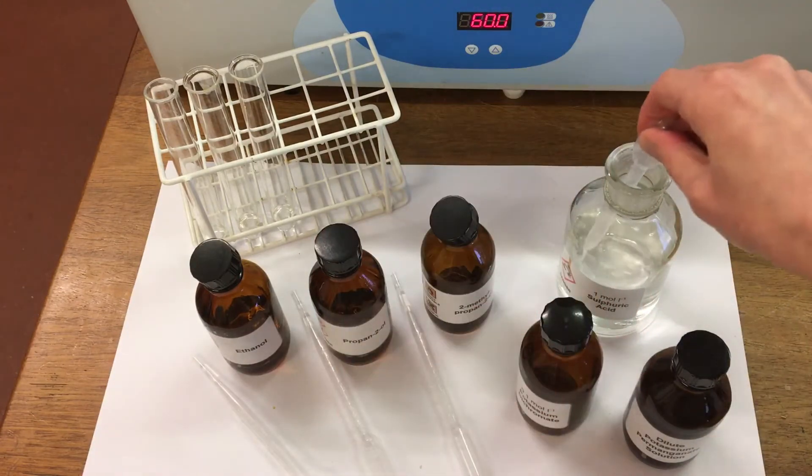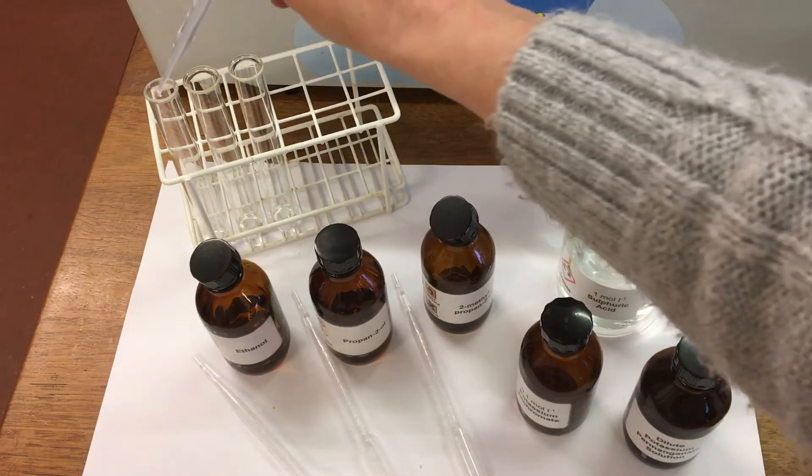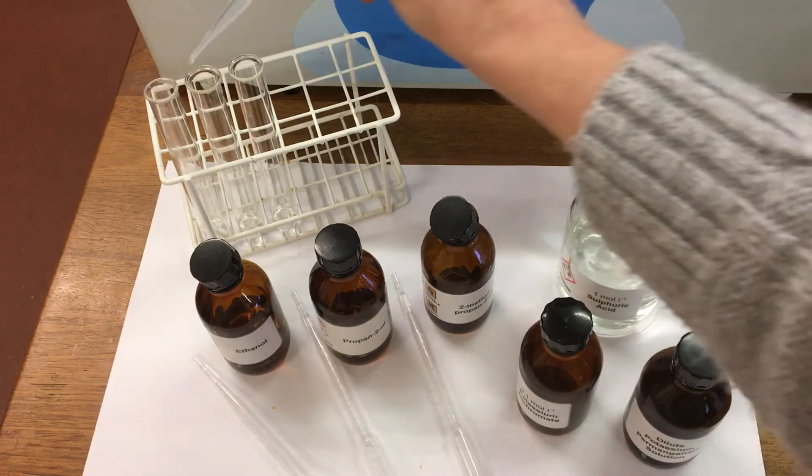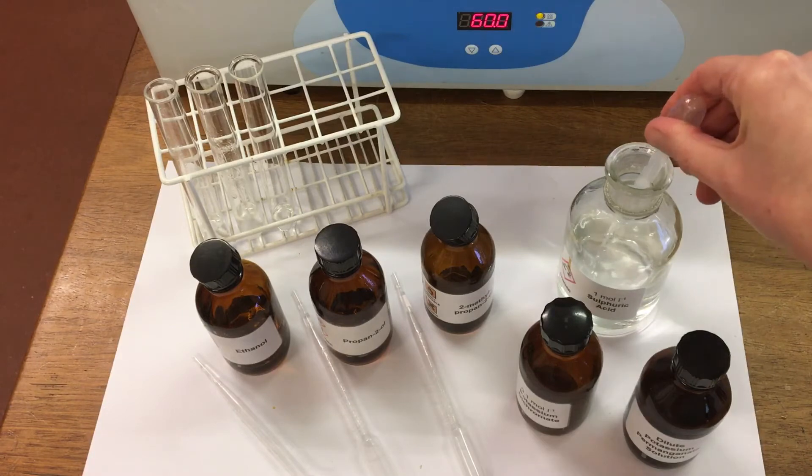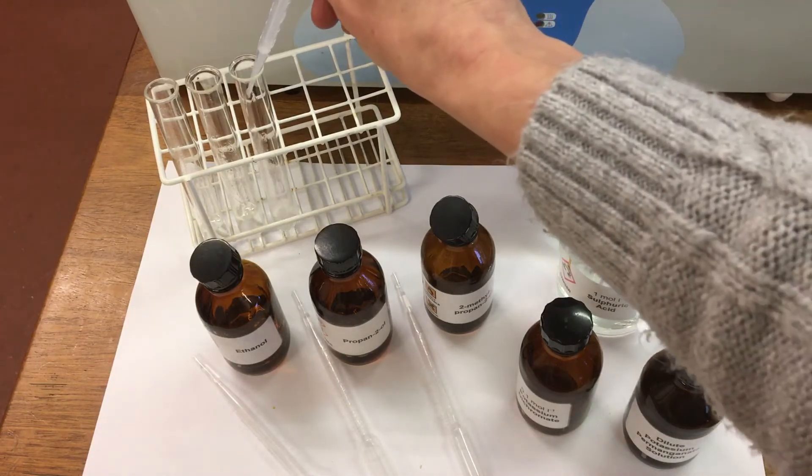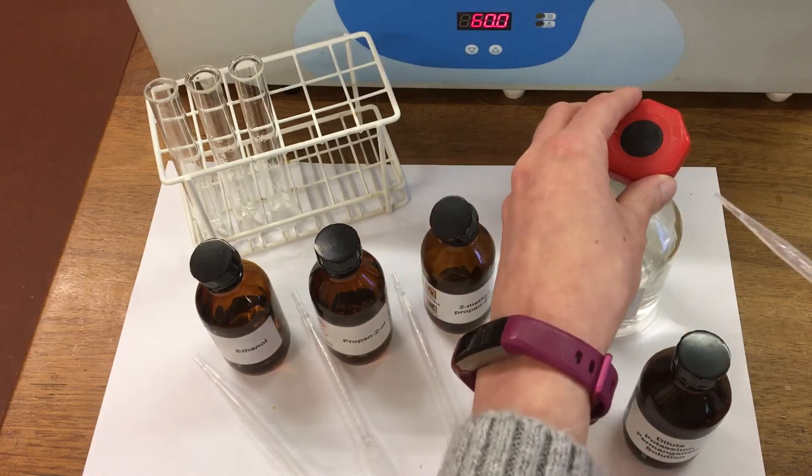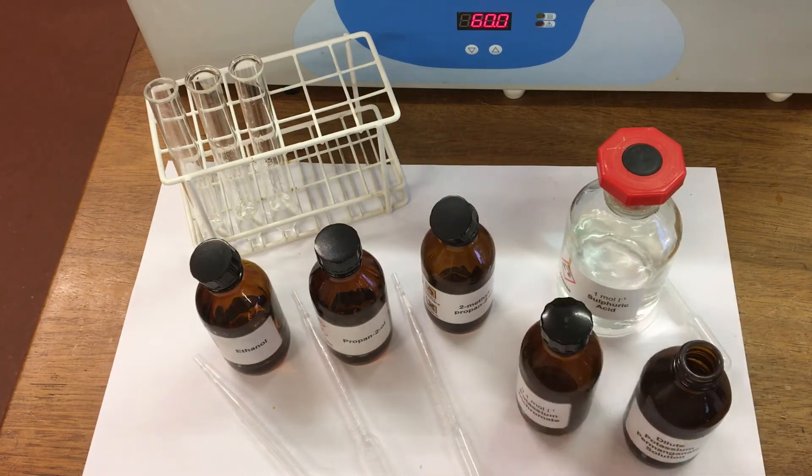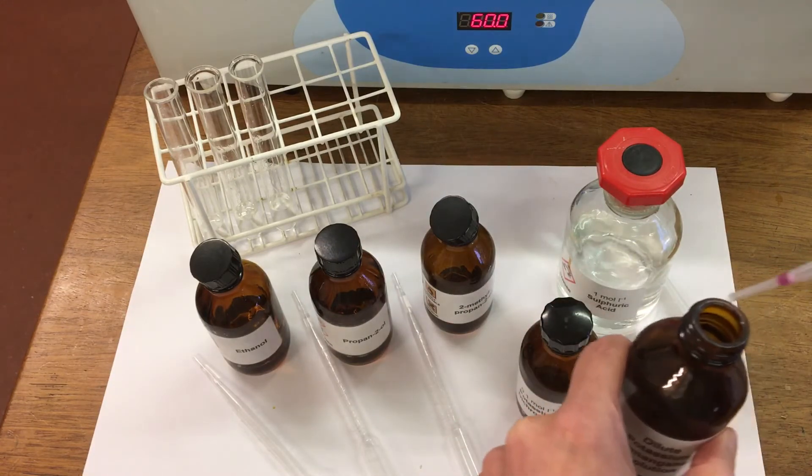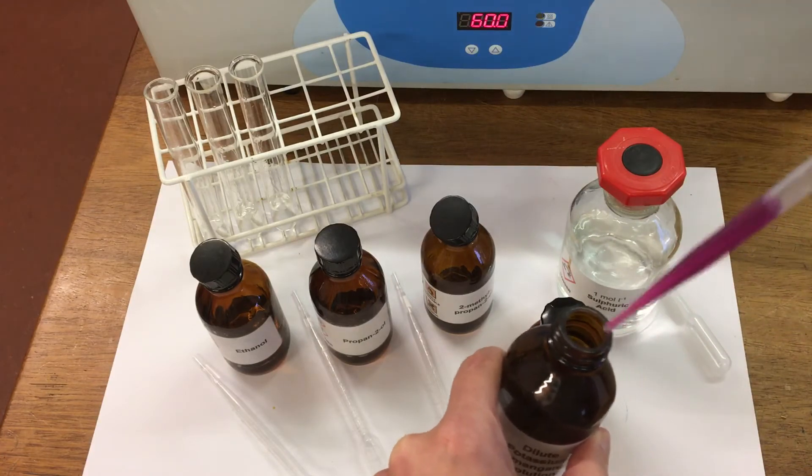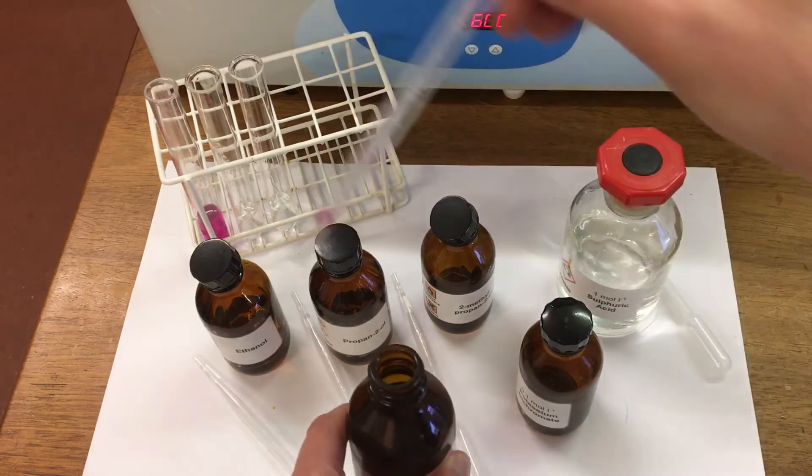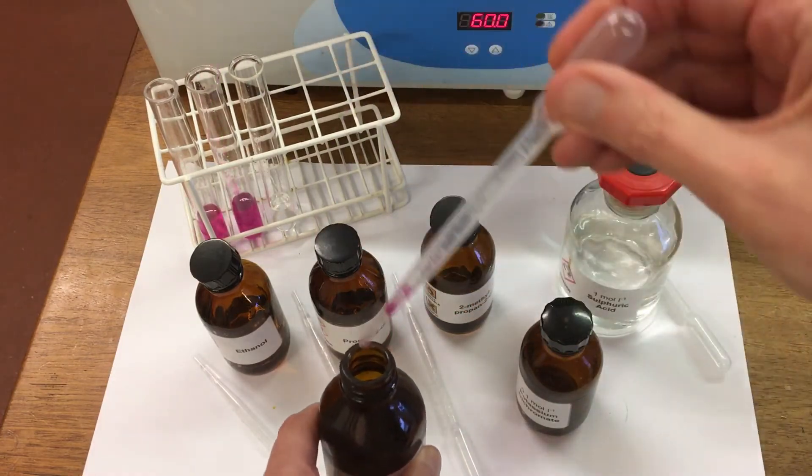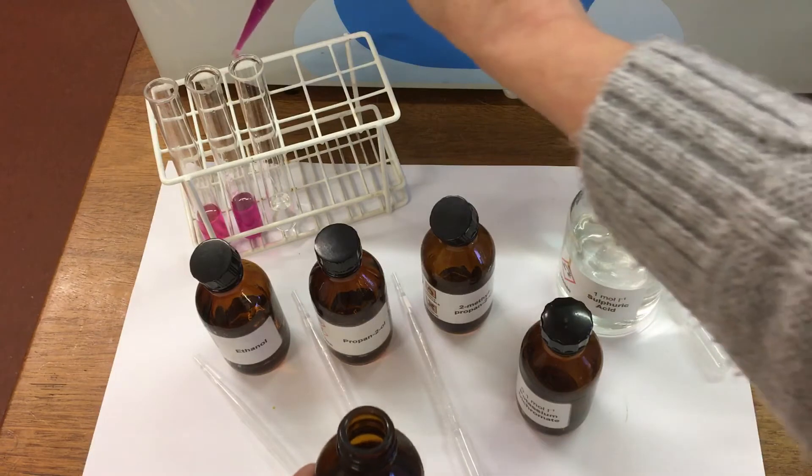And then the sulfuric acid. And then this time we're going to use the potassium permanganate solution. So this gives a purple color.